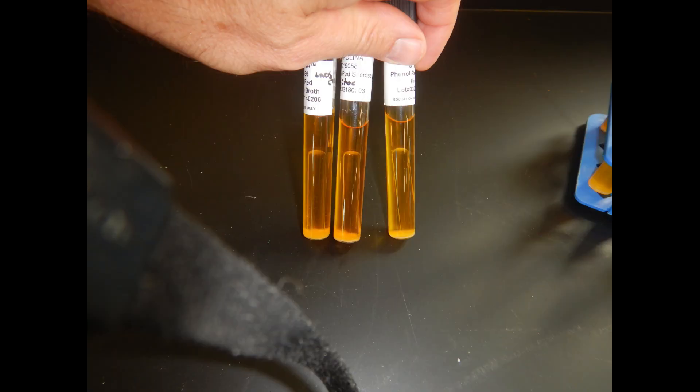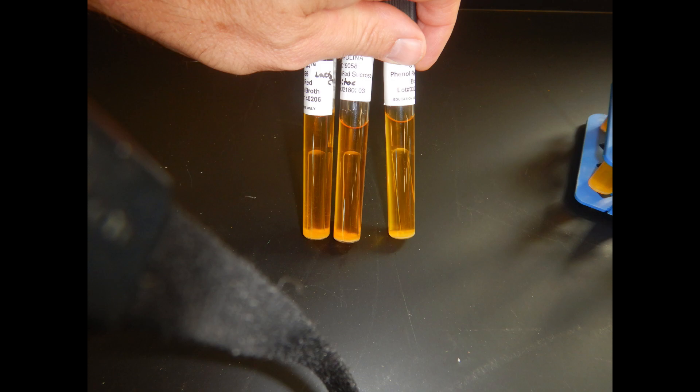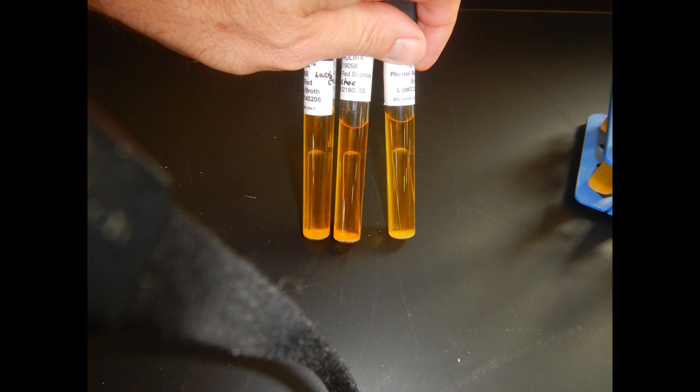This bacteria was able to metabolize all three of those sugars, and the acids produced as the sugars were broken down turned the pH indicator yellow.